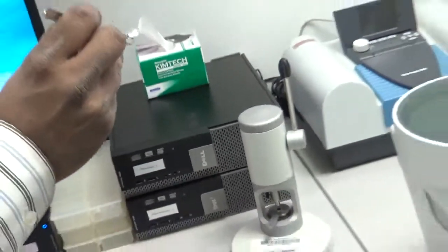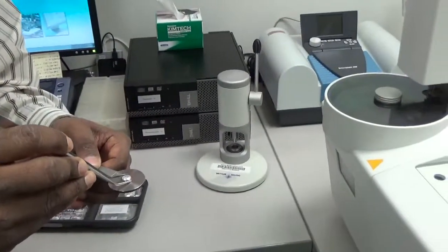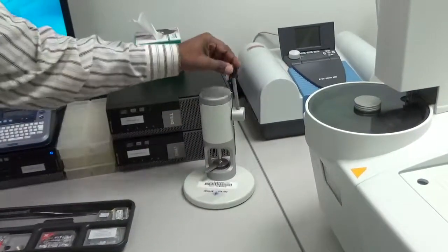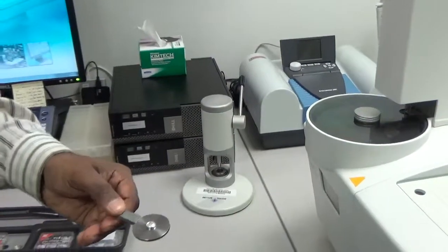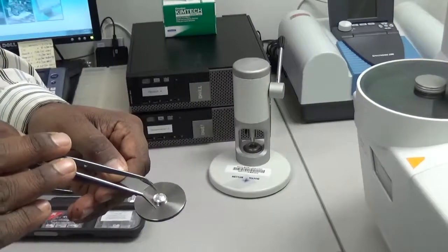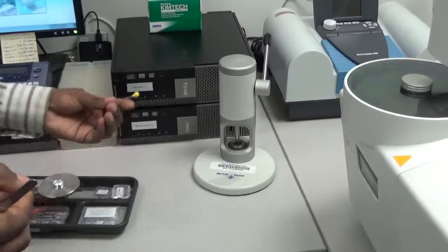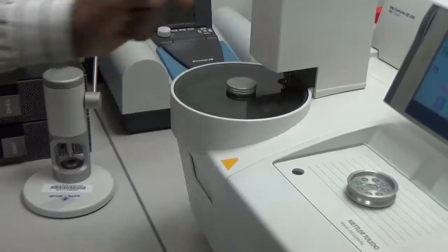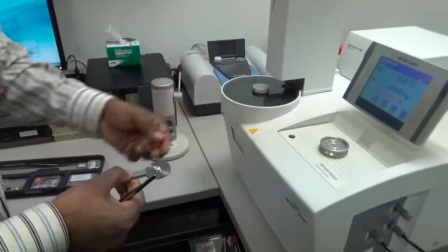To use this crucible, you fill it with the sample, then the crucible goes inside. You put an open lid, place it there, press with the press, and it seals the crucible with the lid. We made a small hole in the lid to release the moisture — this hole is made with this needle. You can manually pierce it, or it can be automatically pierced with the needle in the robot.